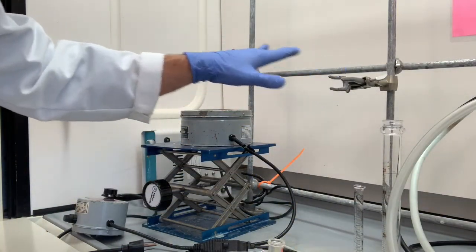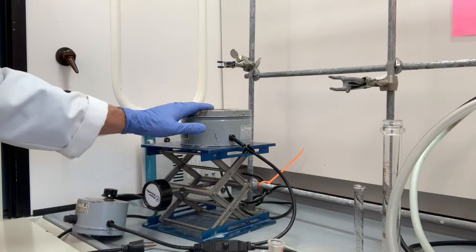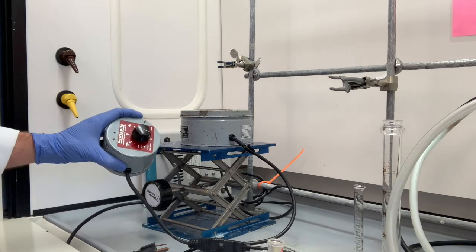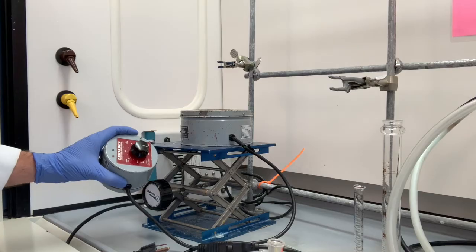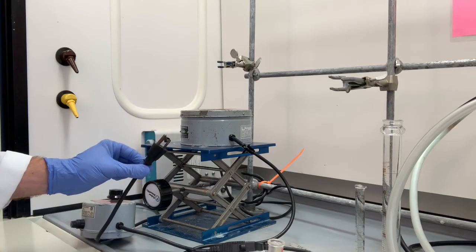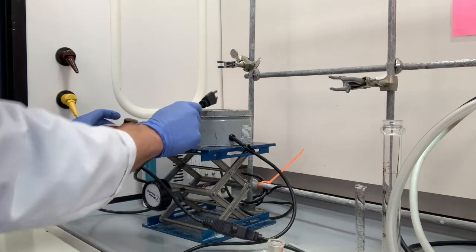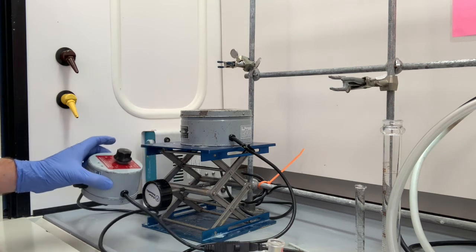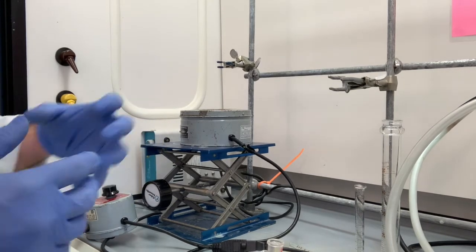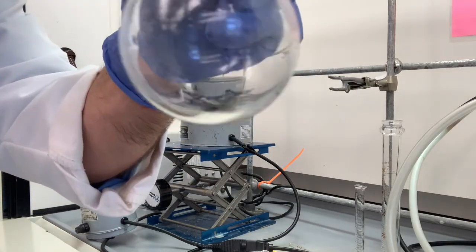I have the clamps already in place and ready to go. I have a lab jack here that's going to allow us to adjust the height of the thermowell. And right here is the variac. That will be what controls the amount of current that enters the thermowell, which is directly related to how much heat will be provided into the sample. Very important, do not plug that in yet. As soon as you plug that in, it starts heating up. Also very important, make sure you have the variac. If you directly connect the thermowell to the outlet, it's going to get extremely hot extremely quickly. So we're not going to plug that in yet, we're going to begin. Something I see students do all the time, they set up all the glassware, but they forget to put in the boiling stones. I have a few right there. We want to put those in before we begin.